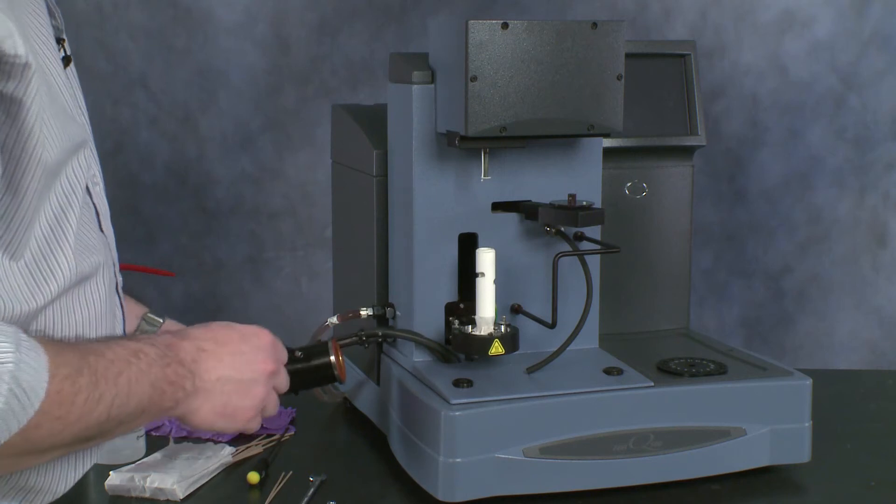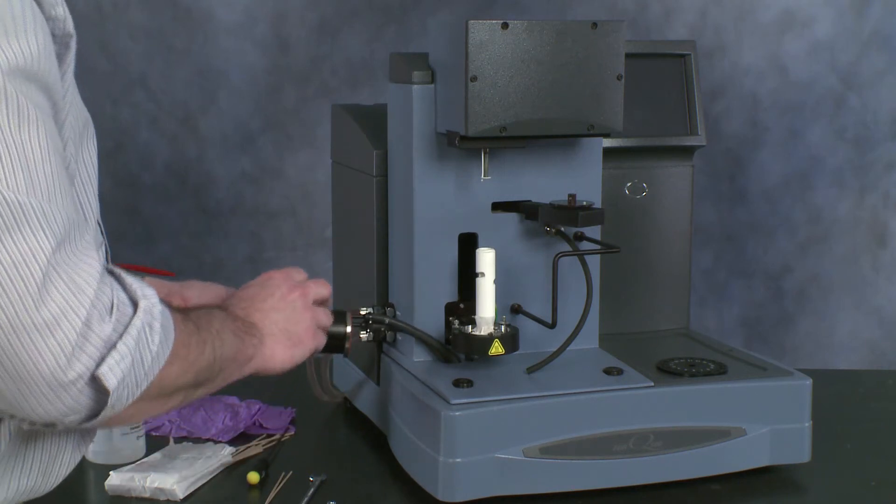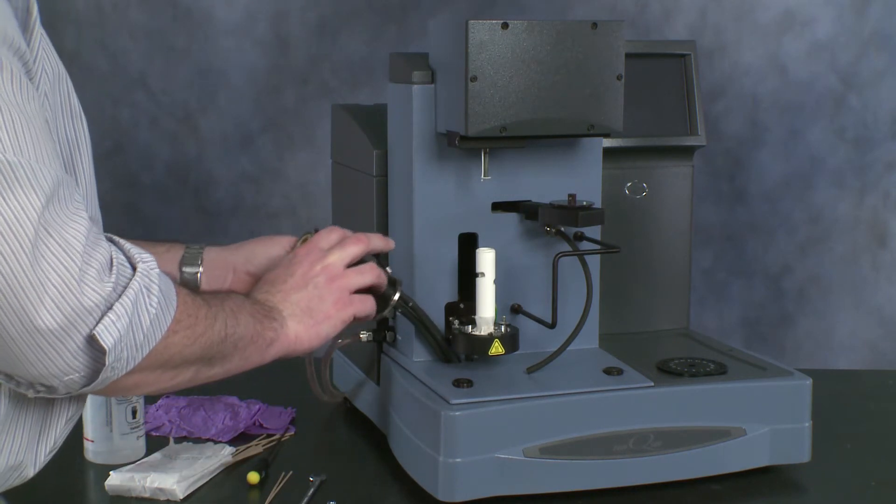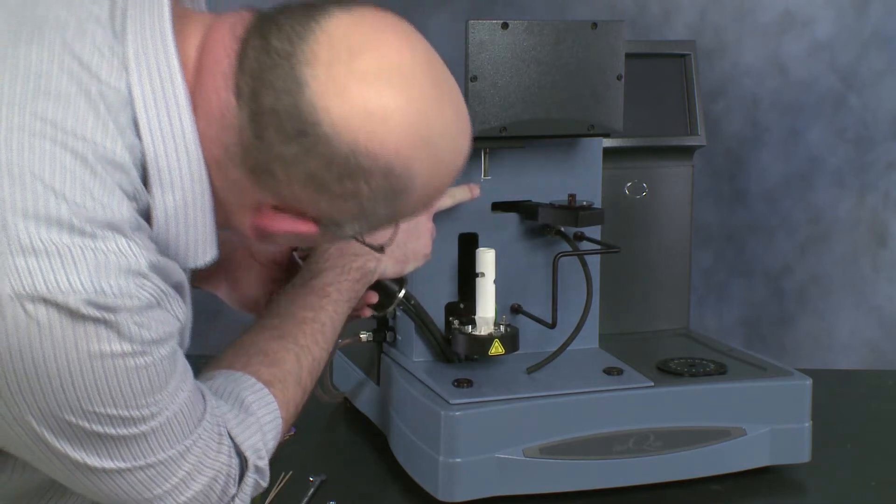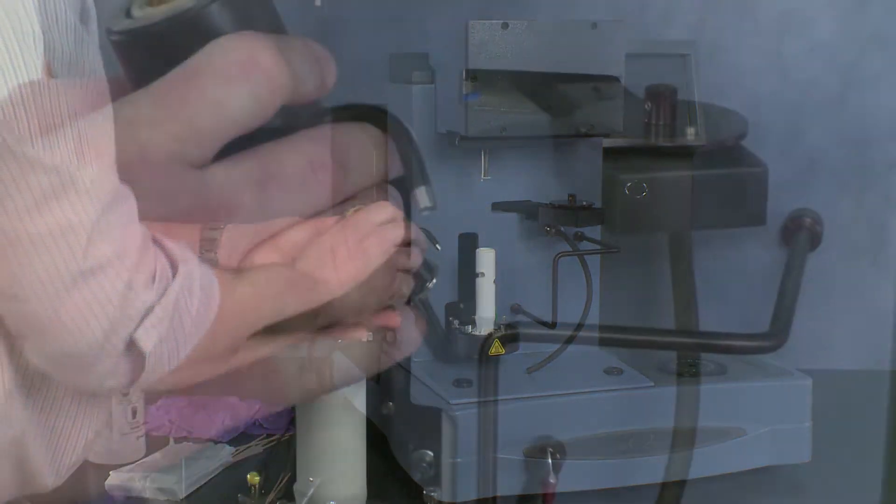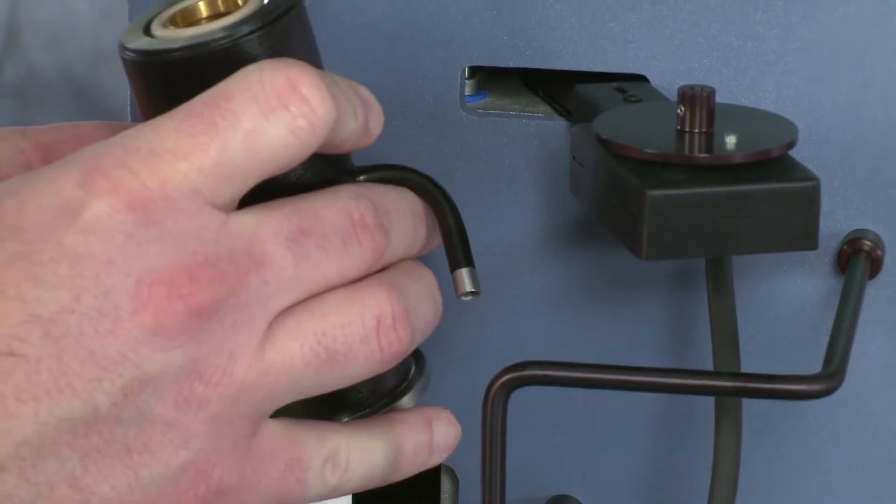Once it's clean, we can then put it back. So this is the reverse process, again being careful of the hang down wire and of the thermocouple and also of the furnace itself.